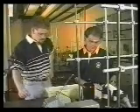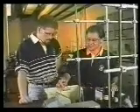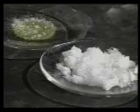Wow, nice crystals. Thanks. I'm recrystallizing a bunch from my lab this afternoon. You know, it really feels good to turn a mess into something beautiful like this. Oh yeah. Recrystallization is a basic purification technique. Let's watch how the stagehands do it.